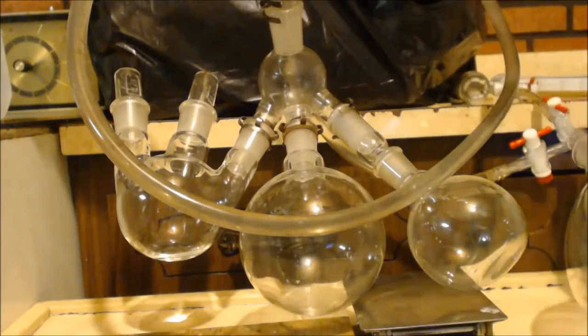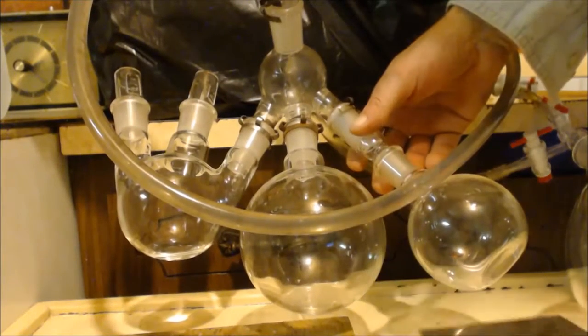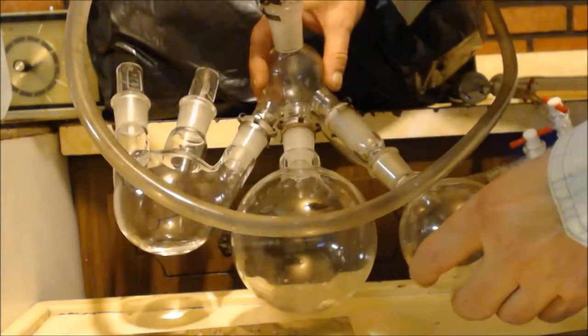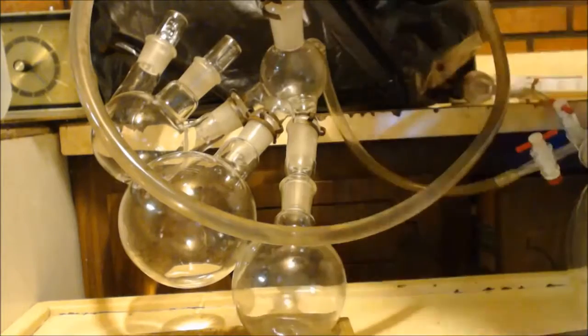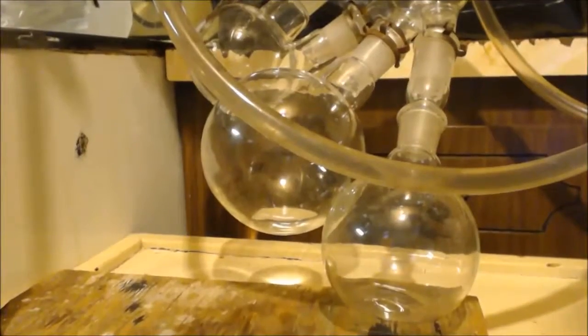I have between the first one and the middle one. It's definitely all the water is out. So I'm going to move us around to the last one. Now it has no choice but to come down here. Let me pump it. You can see these are clear when I'm distilling. I only got this much for the concentrate. Like the last batch. There was three batches. This is 150 milliliter flask. I only got 35 milliliters in there. That's from both batches. The middle batch and the last batch.